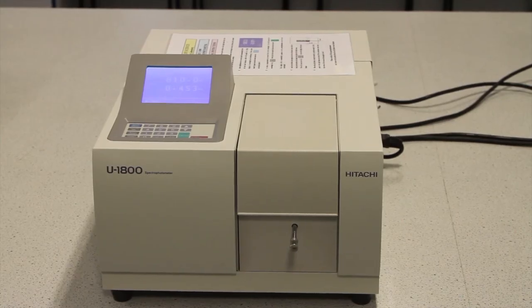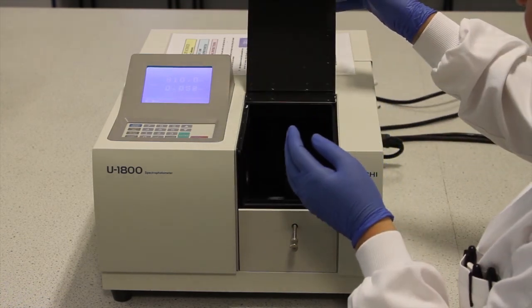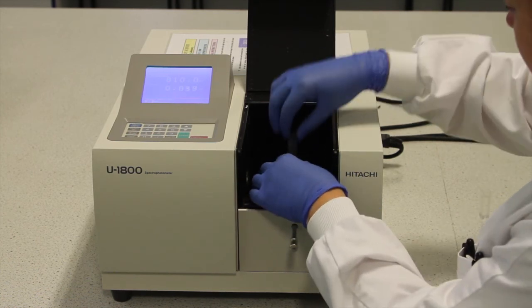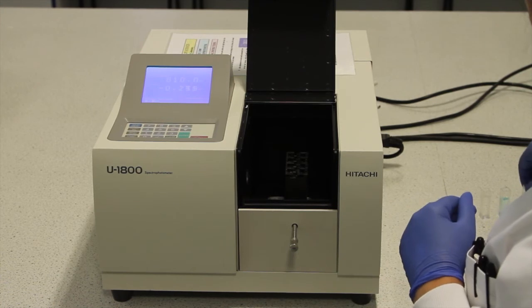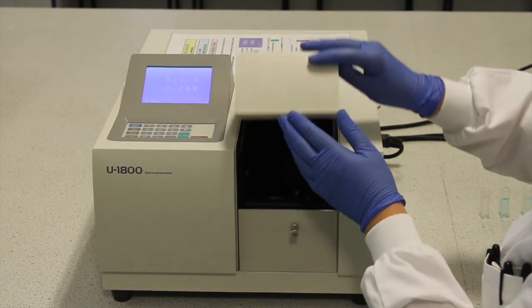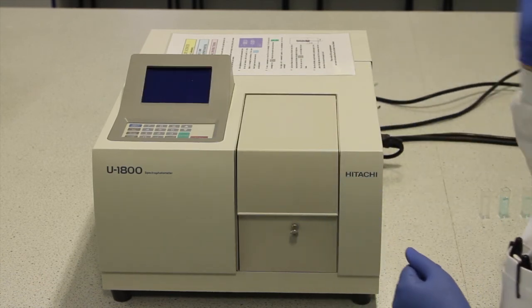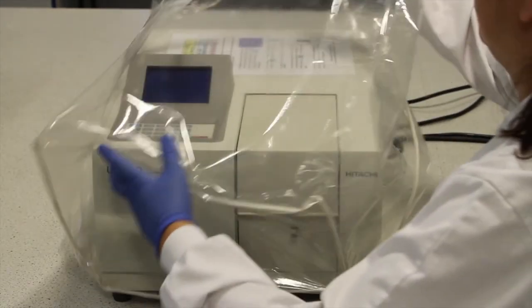Once your experiment is complete, you should carefully open the lid and remove all cuvettes. You should take care not to spill any solutions in the machine. You should then push the lever back fully and close the lid. Finally, you should switch the machine off and replace the dust cover. You should rinse out the used cuvettes with deionised water for reuse or dispose of them into the waste bin.